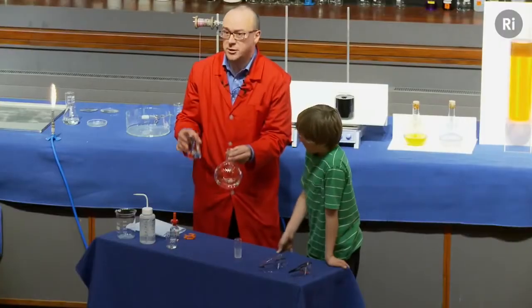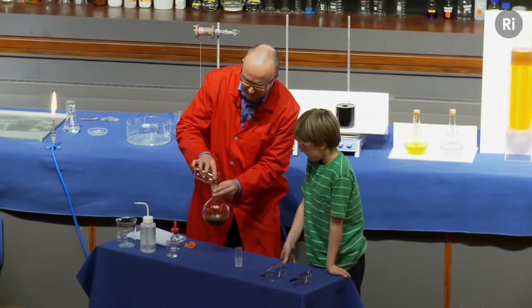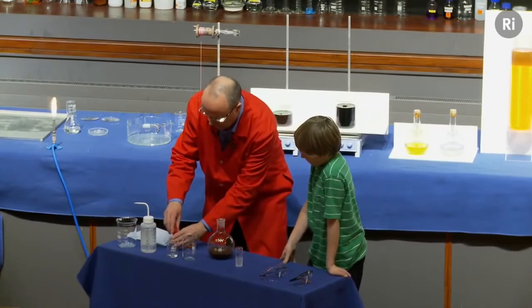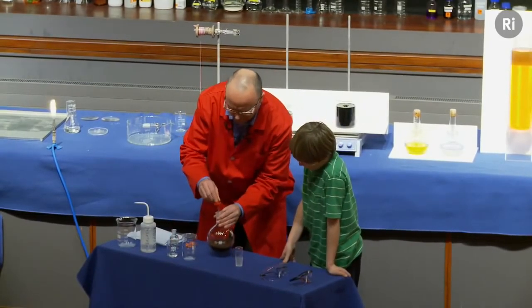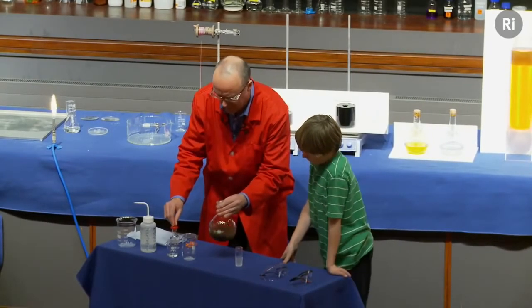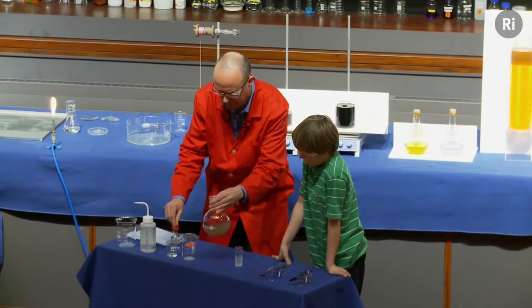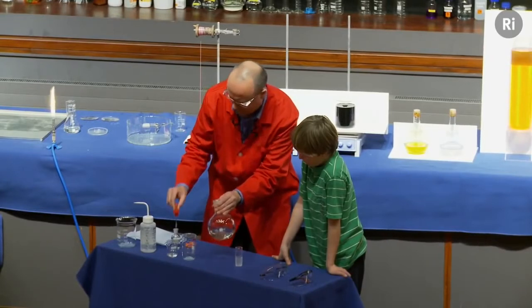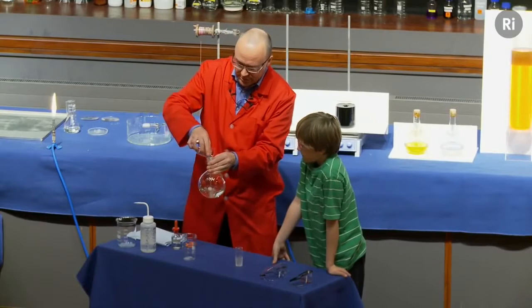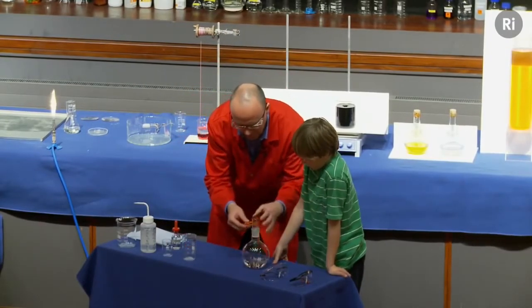Now what I'm going to do is to add some sodium hydroxide. That's now formed a sort of very dark brown, almost a black material. So I'm now going to add more ammonia. And again, I'm going to add ammonia until the liquid goes back to being colourless. This takes a moment or two. There we go. And then finally, I'm going to add some glucose. So there's the glucose. Now I'm going to put the lid on, put a clip on.